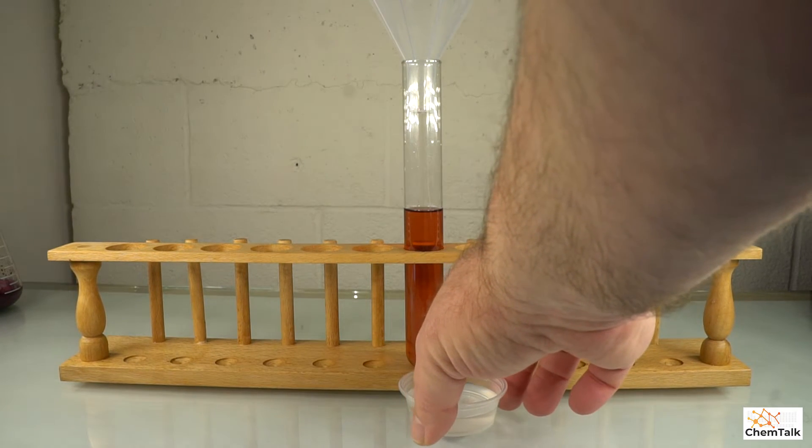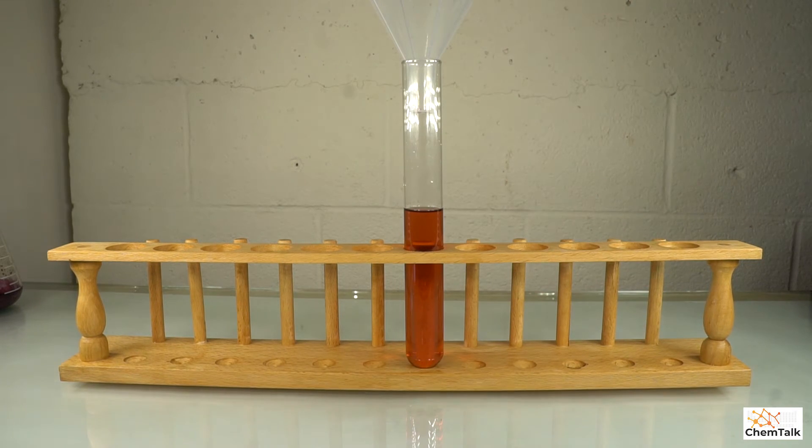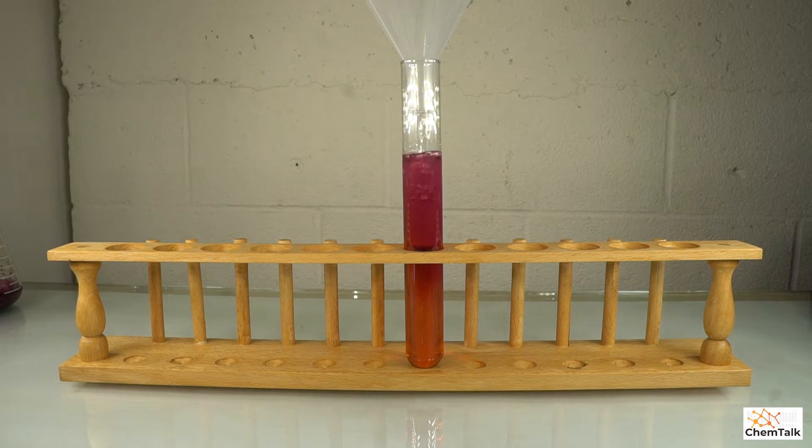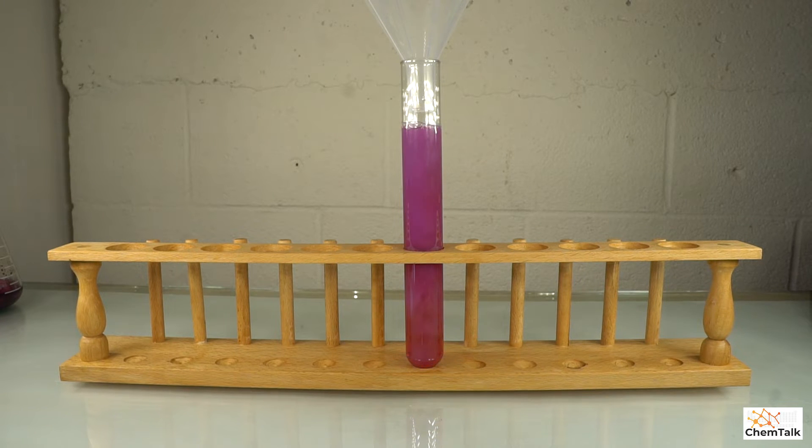And now I'm going to pour the sodium molybdate in there and you're going to see a double displacement reaction. There we go. Look at that. It's so beautiful. It's forming this really, really nice purple precipitate.